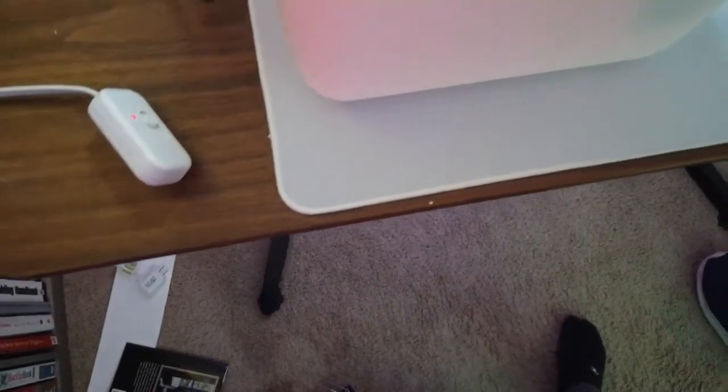I need to make sure it stays stable at this. We're going to leave it overnight, and if it's exactly the same in the morning, then I'm going to feel pretty good about the setup, because I really would hate to put all these petri dishes in there and have the bacteria die immediately. So I was expecting, I don't know what I was expecting, but I wasn't expecting it to get so hot so fast, because it was boiling hot in there.